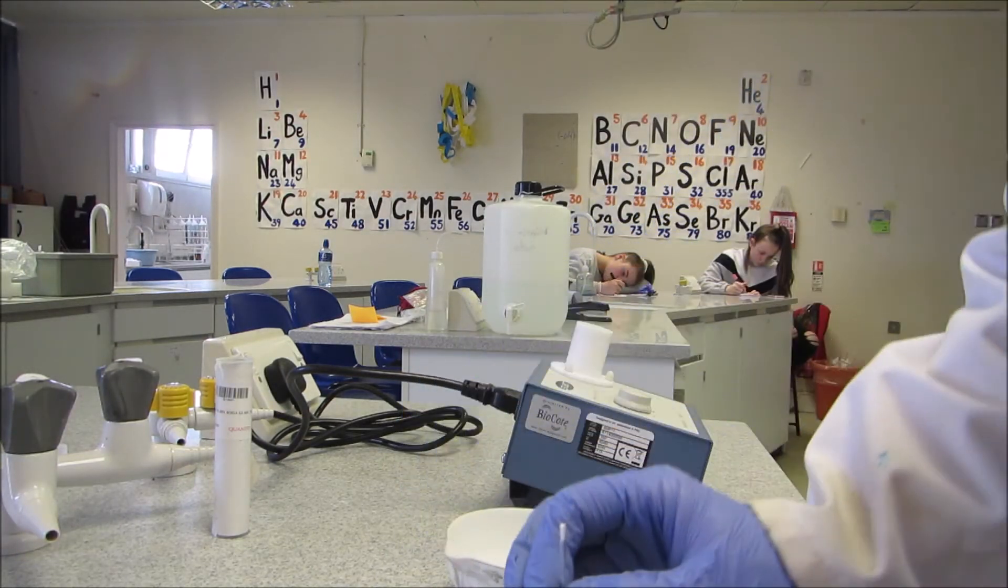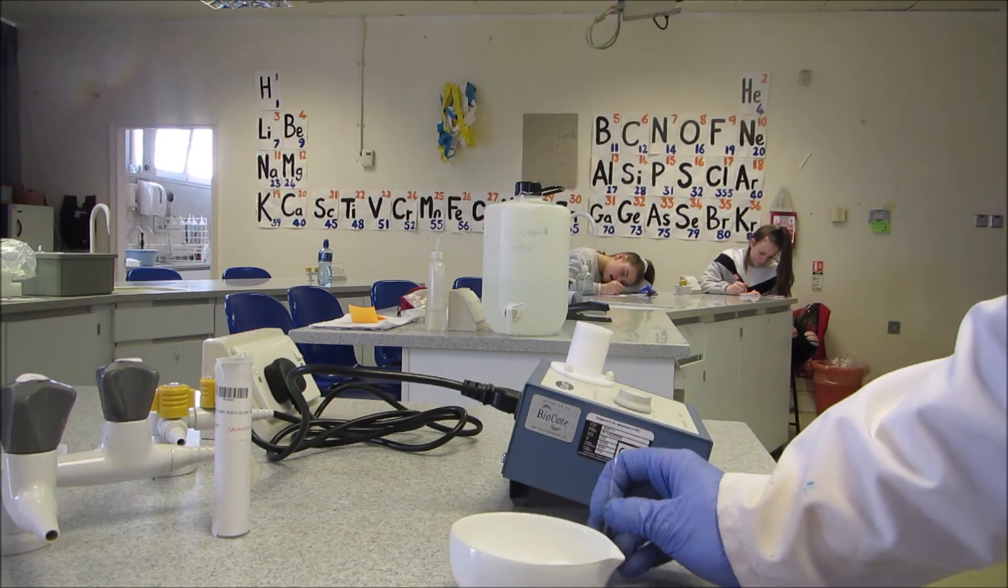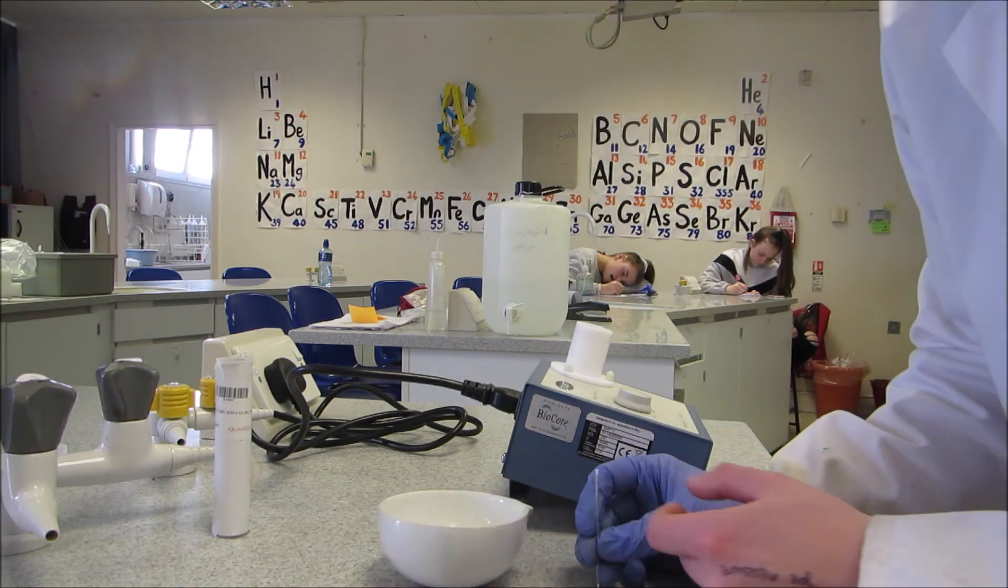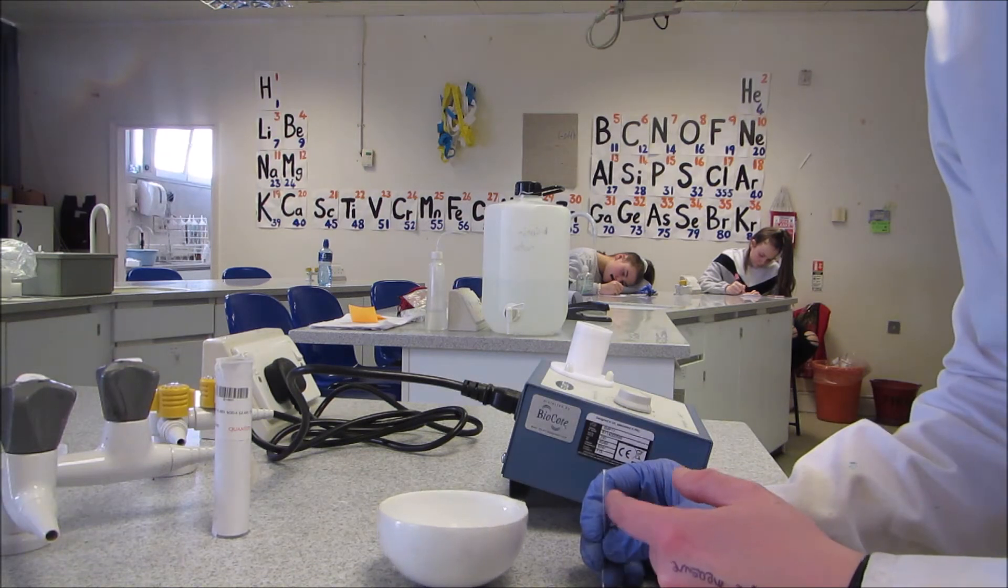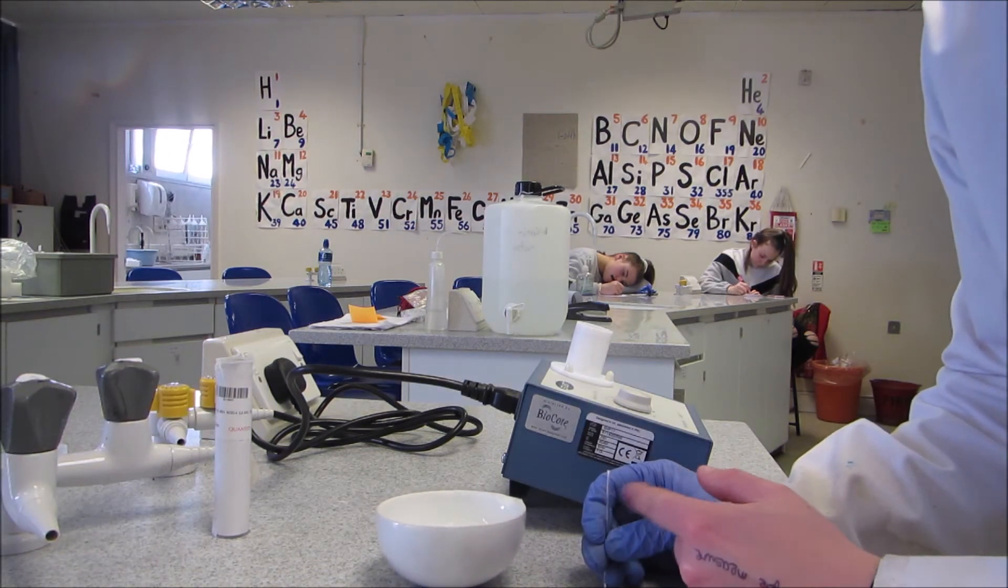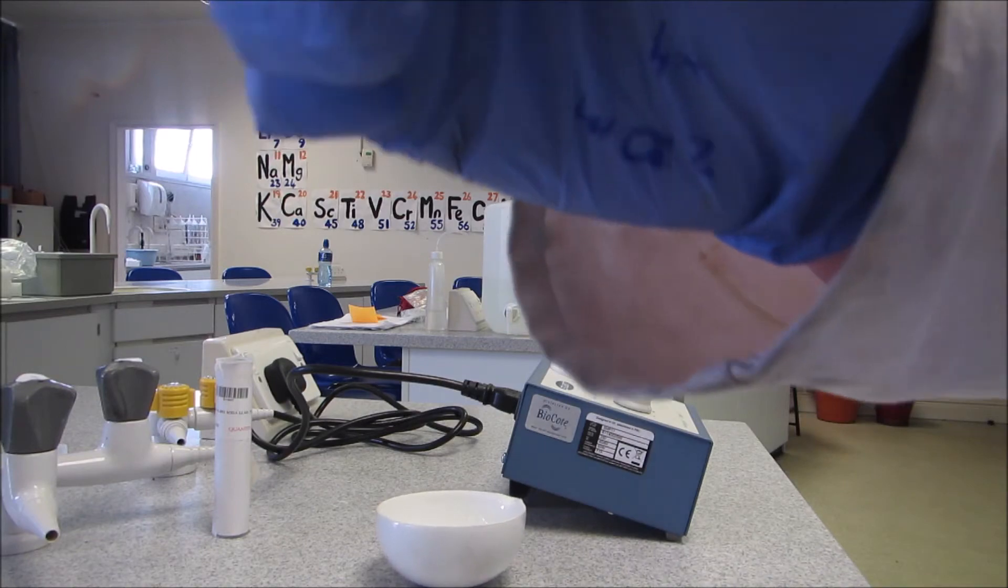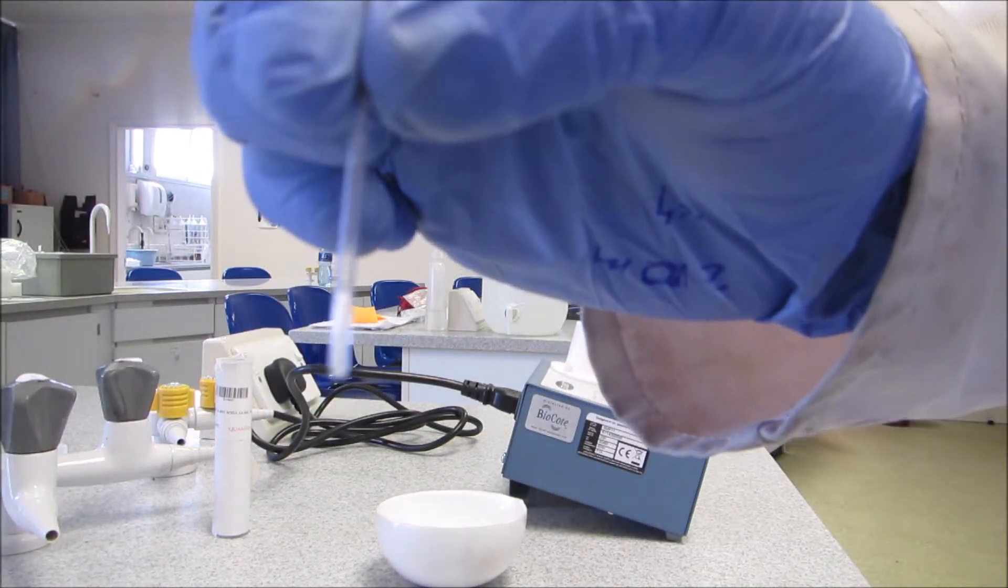I'm now then going to tap it off the bench, get the crystals to go down. You may also have to flick it gently with your finger. As I'm flicking it, they're falling down to the bottom. And now I have lots of crystals like this.